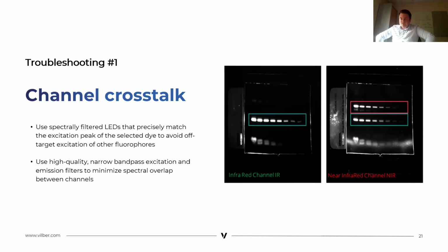This occurs when the excitation wavelength or emission of one dye is too close to another, causing signal to overlap. To avoid this, you have to use spectral filtered LEDs that precisely match the excitation peak of your selected dye. You also have to use high quality narrow band pass excitation and emission filters. With this kind of filter and excitation, you will minimize spectral overlap between channels. So it's very important to understand that if you have a crosstalk channel, it's due to your imager, it's not due to the dye.